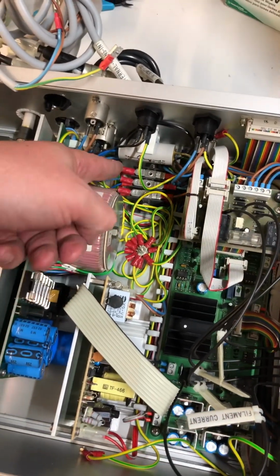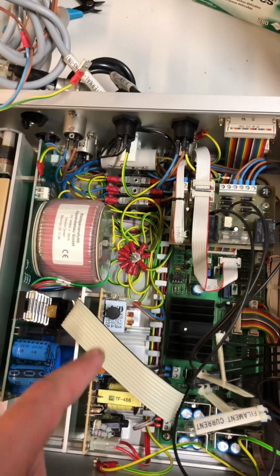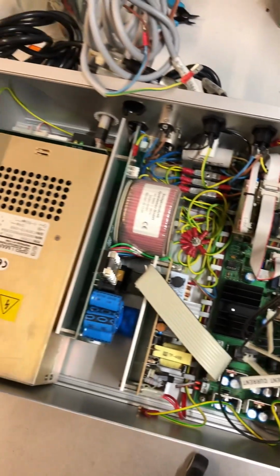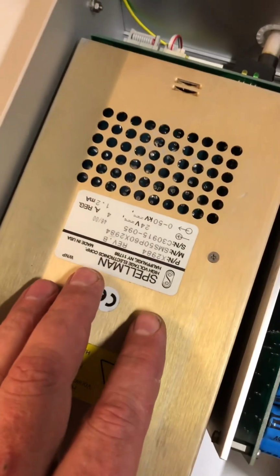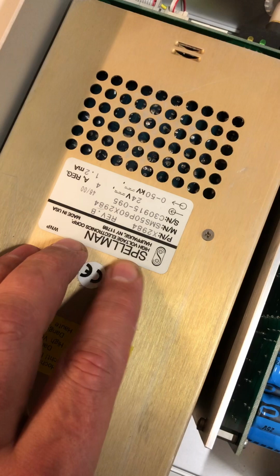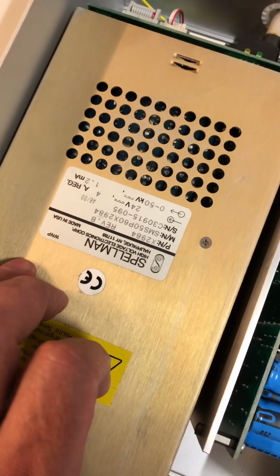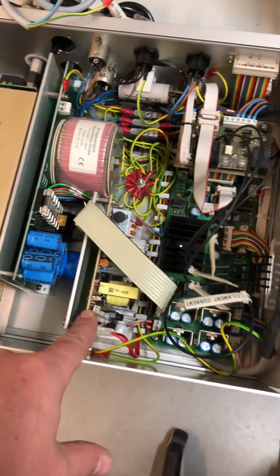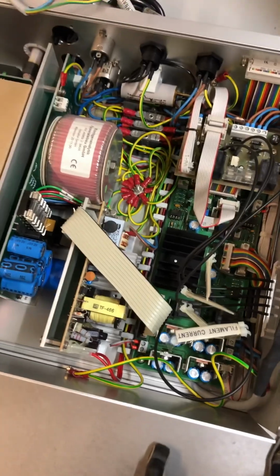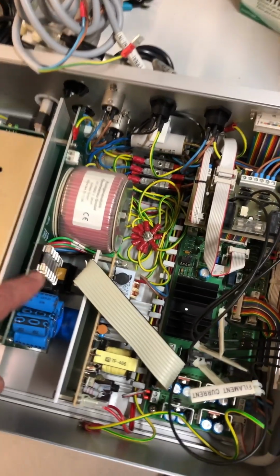Inside we have power distribution and a very funny earth connection in one single point. Then we have a 0 to 50 kilovolt power supply, 24 volts, Spellman, a company from the USA. And on the back side we have the high voltage output and interlock relay. It needs 4 amps, 24 volts, which are produced by this PC type power supply. And there is a transformer with many fuses.